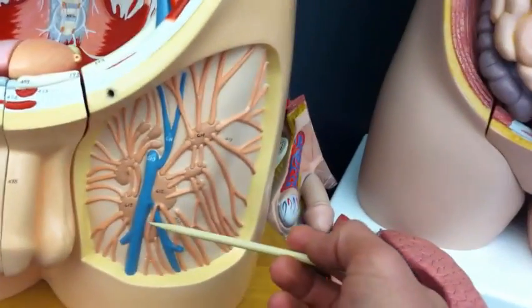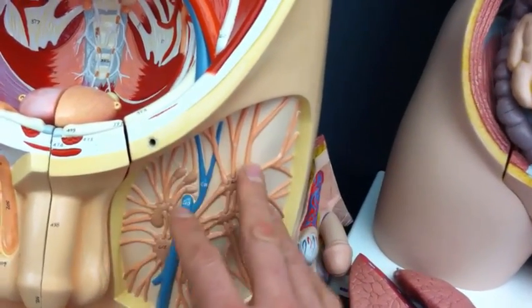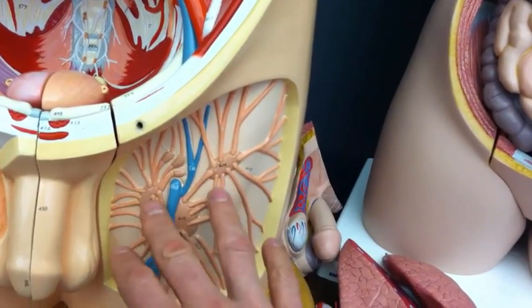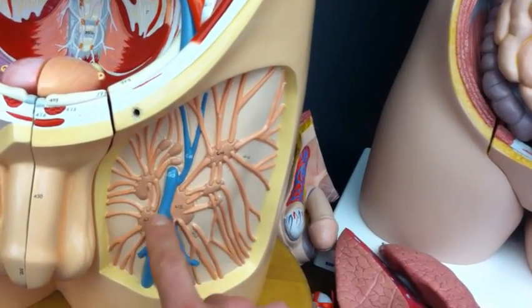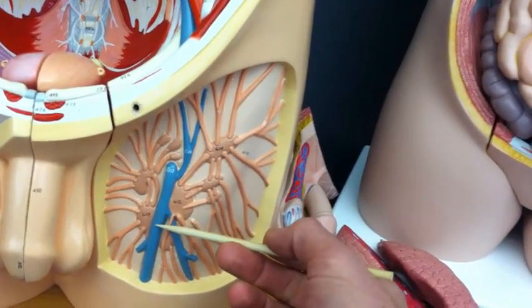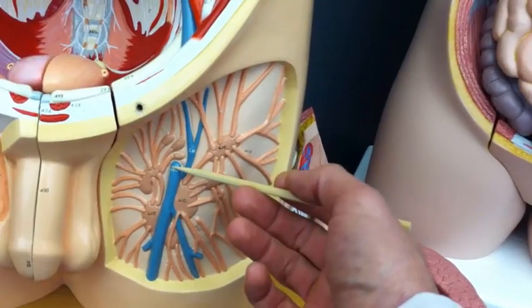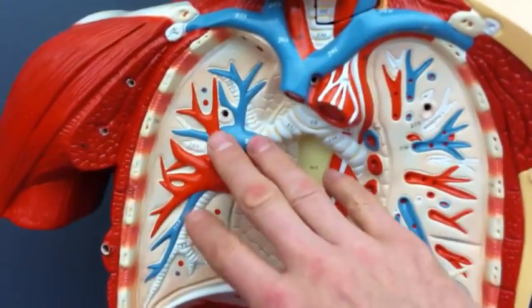On the other side of this particular model, they've got connective tissues up here. They've dissected, or are trying to show dissection, it's more superficial. So we don't see the femoral artery and vein here. Rather, we see one of the branches from the femoral vein. This is great saphenous vein, so this would be left great saphenous vein. Apart from that, on this model, I skipped over the lungs over here.